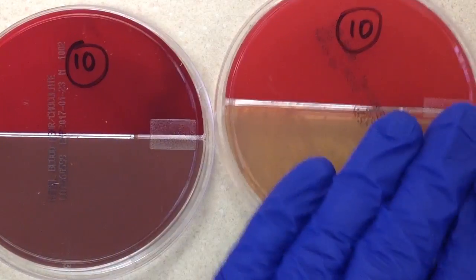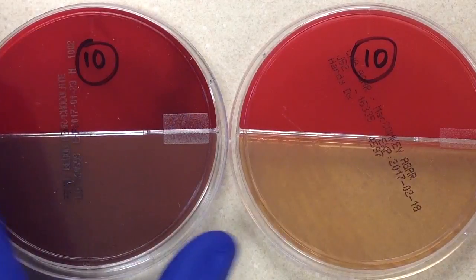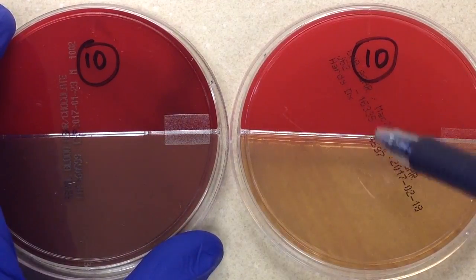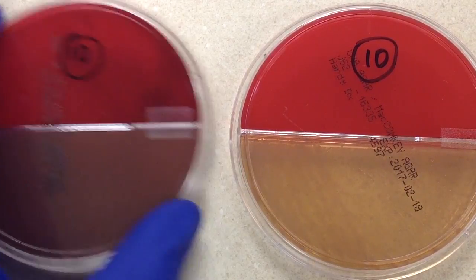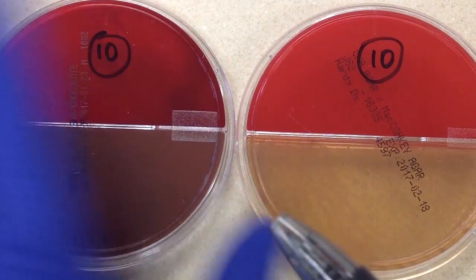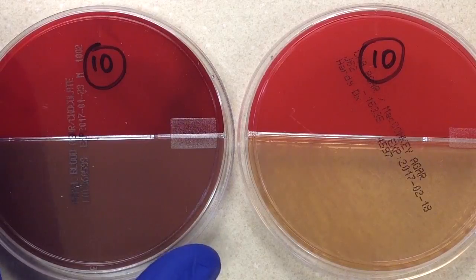Your microbiology instructor may require you to gram stain everything, so follow what they tell you. We're not going to do the oxidase off the MacConkey's because the oxidase is a color-based test, and if the colonies were pink that could interfere with reading the colored results. So we'll take the sample off either the chocolate or the sheep blood. After that, it's straightforward — this will be set up on an instrument for identification and susceptibility testing.